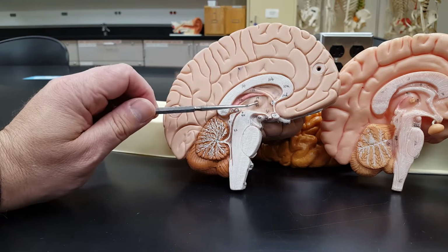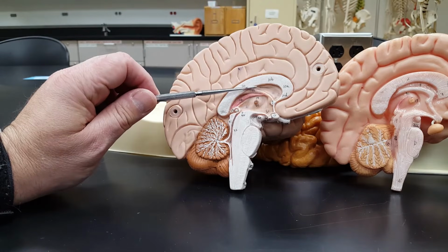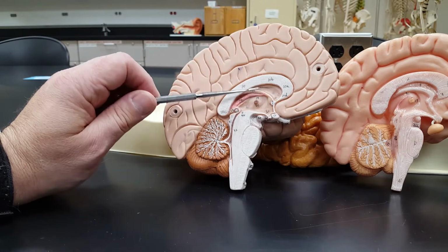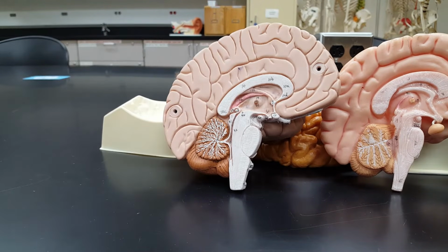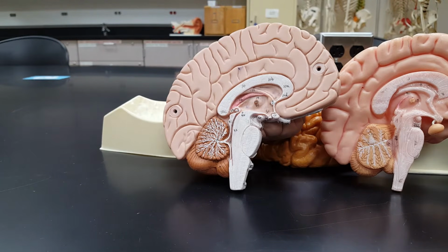But there are physical neurological structures found right here as well. Now this region, from here to here, would be called by many the diencephalon, which is actually, in my humble opinion, a name best suited to the embryonic brain. So I want you to mark my words right here. In fact, hey, why don't you mark your words in the lab manual?